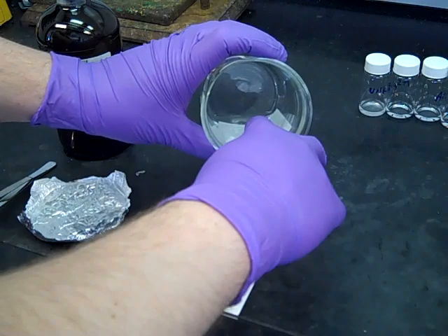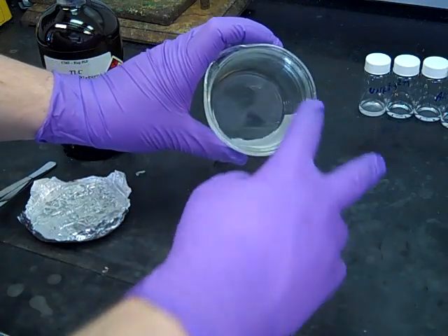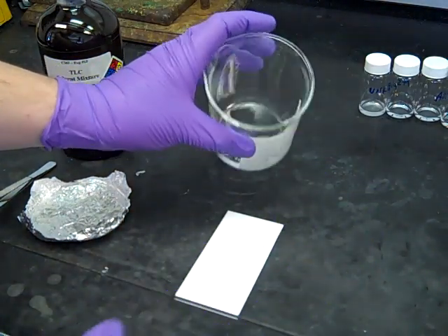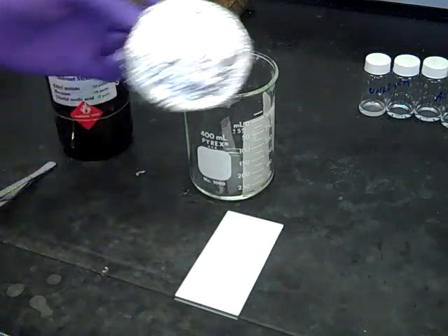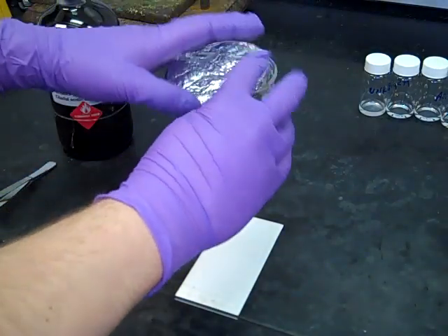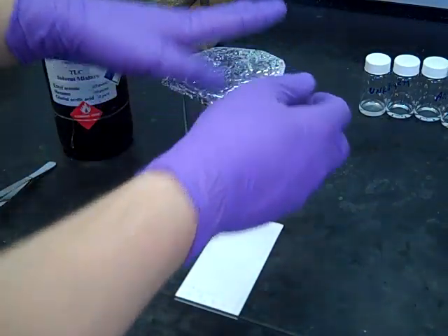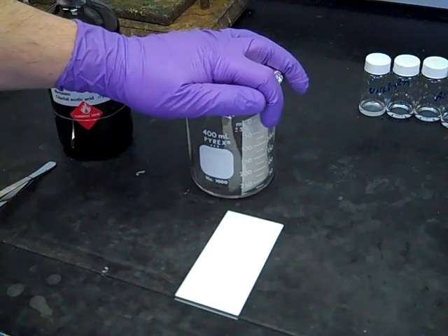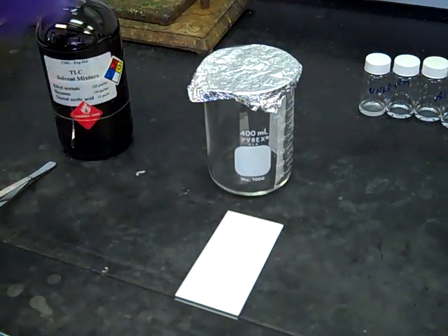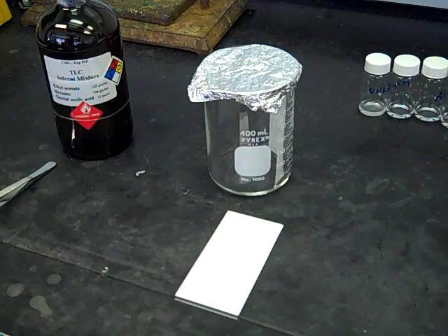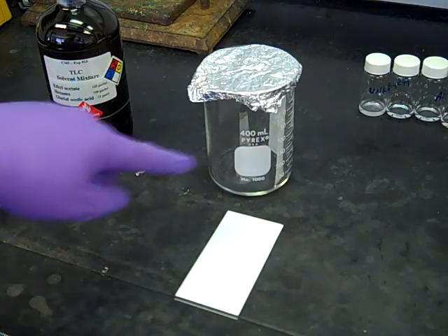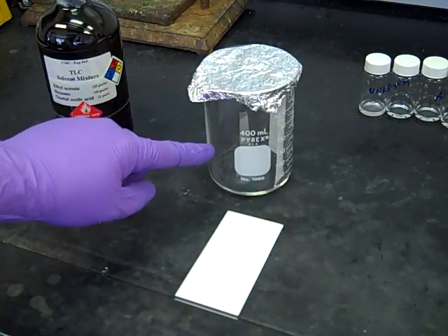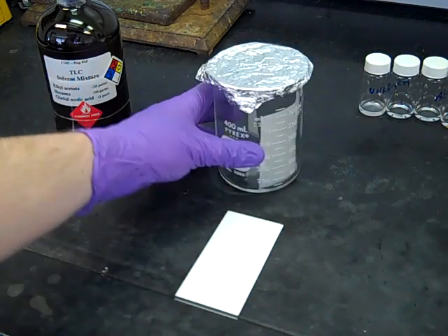You'll also need your filter paper—dip that down in the solvent and let the solvent travel up that filter paper so it adheres to the wall of the beaker. Once you do that, close up the top.